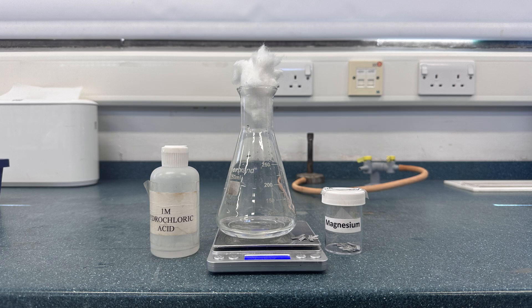Our second way to follow the rate of reaction is to carry out the same reaction, but this time put your reaction vessel onto a balance. You can then watch the mass loss as the reaction carries on. Here you can see we have a conical flask with our acid already inside. The magnesium ribbon is already on the balance as well, and this will give your start value. We put some cotton wool on the top to prevent any spray.